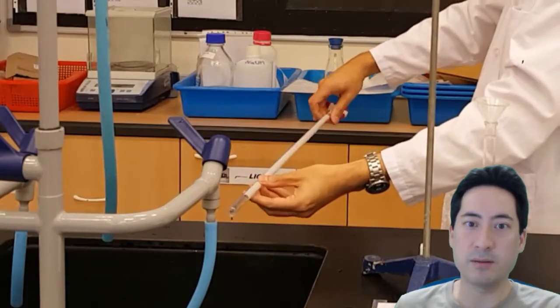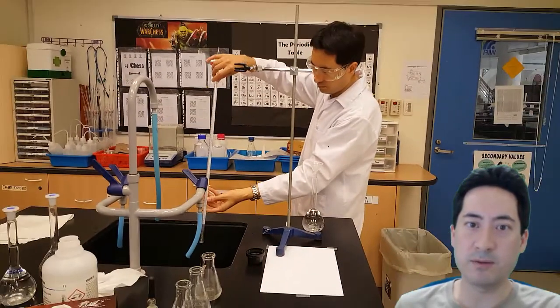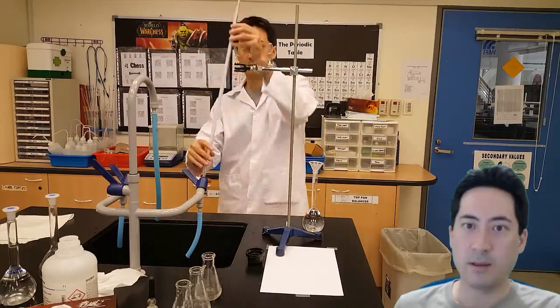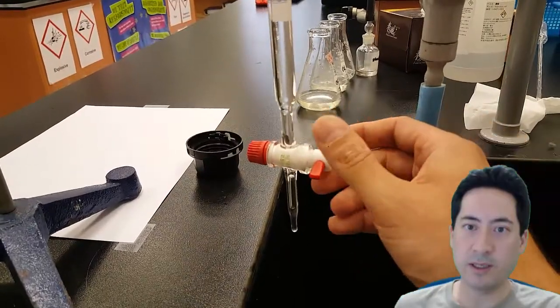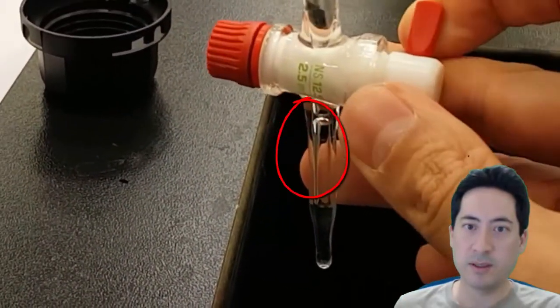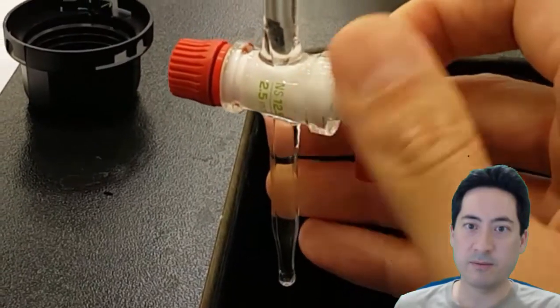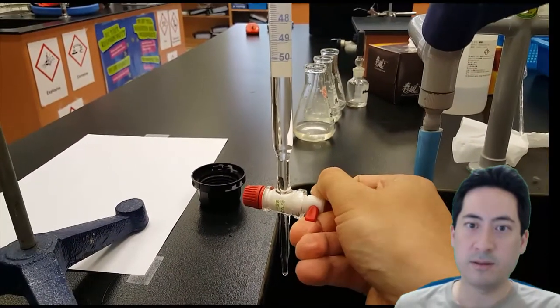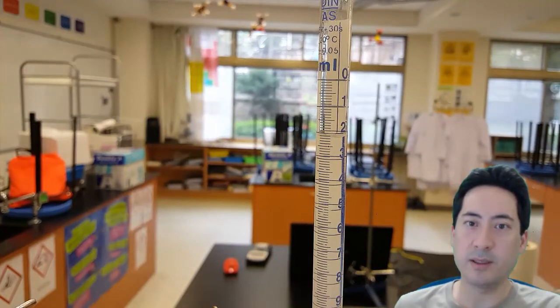Here I am using a little bit of liquid to make sure the whole thing is being rinsed as I pour it out. And make sure before you start that you've gotten rid of any of these air bubbles that are just below the little valve here. And so that's removed as well. You could also get a tissue to wipe down the outside of the burette there.